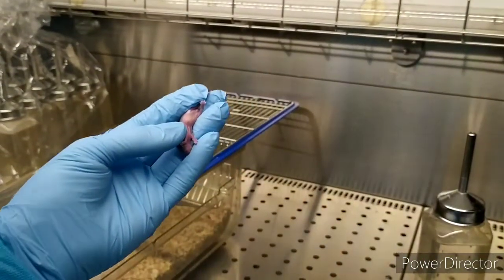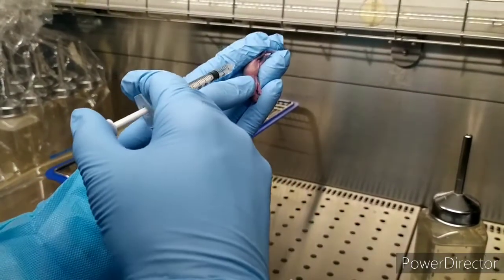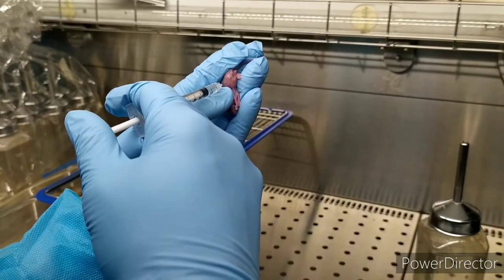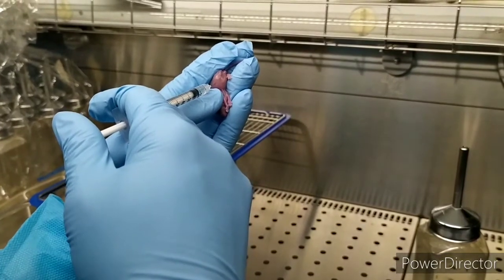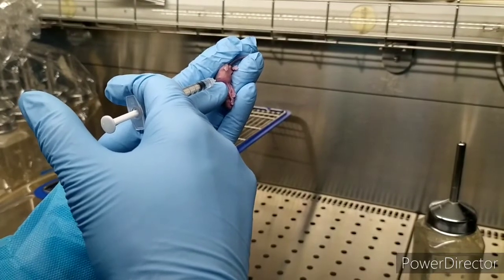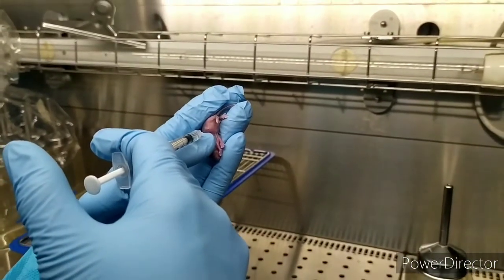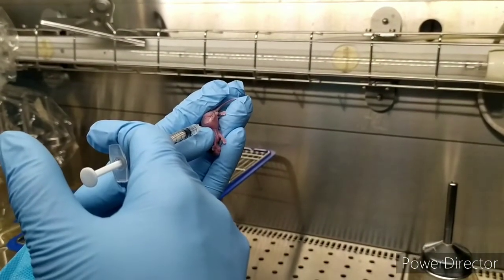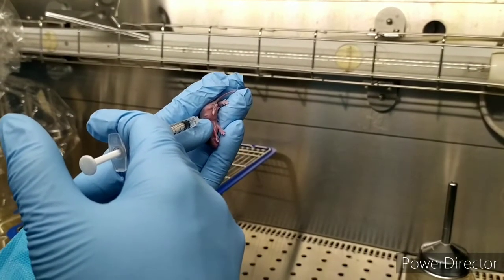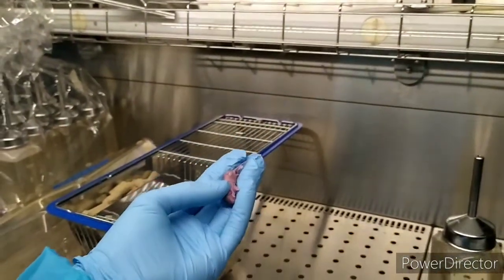See, and also stomach — still stomach. Then vertically inject: one, two, and three, and wait. This one must be careful. The needle — you shouldn't inject into your finger. Careful, wait. Don't worry, wait. Slowly. Okay, this one's perfect.